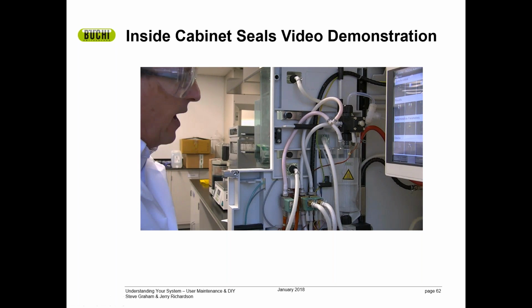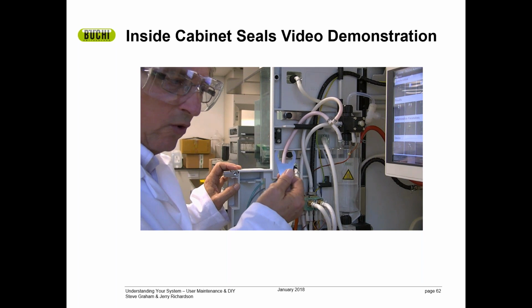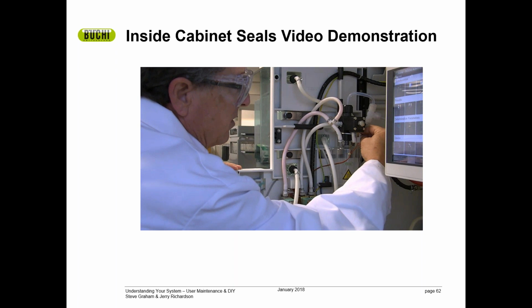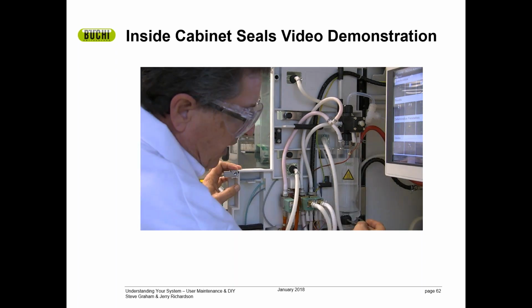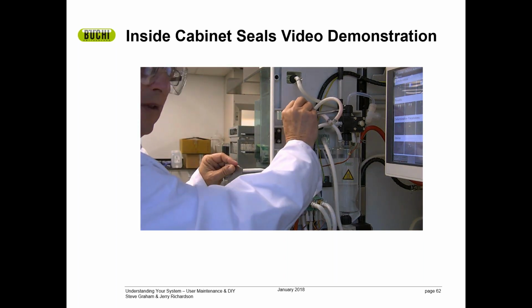Now that we've seen how to tighten the seals on the front of the cabinet, let's take a look at the seals on the inside of the cabinet. I have opened the cabinet door. There is no reason to power down for this part of the maintenance. However, there's very important seals inside the cabinet that need to be addressed. These seals are addressed using your tool that we used on the front. This is the SVL22 tool. You simply put it on these black fittings on the top of the aspiration vessel and on the bottom of the aspiration vessel and at the very top on the aspiration valve.